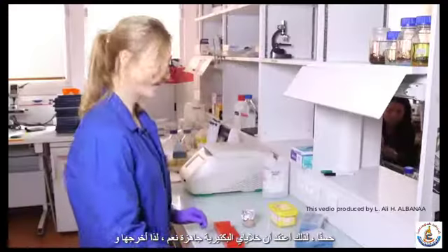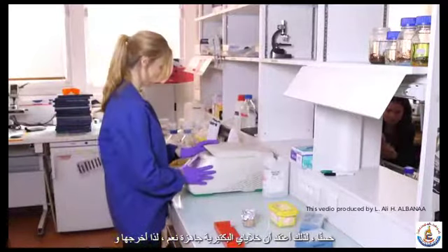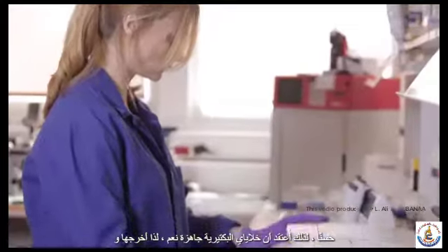Okay, so I think my bacterial cells are ready. Yes, they are.